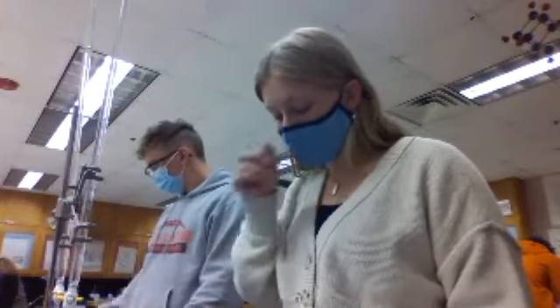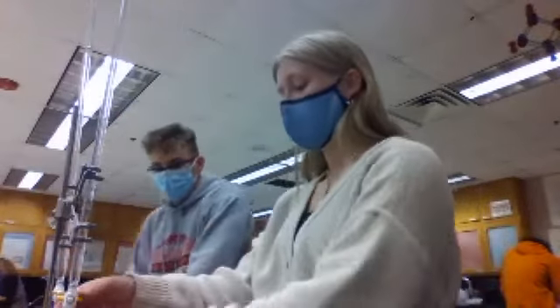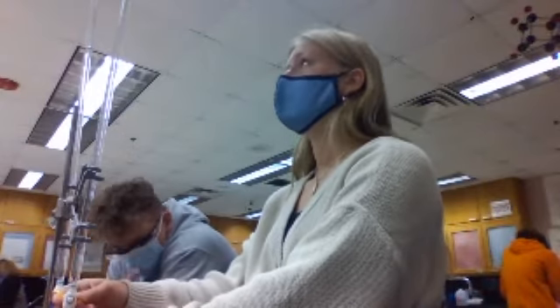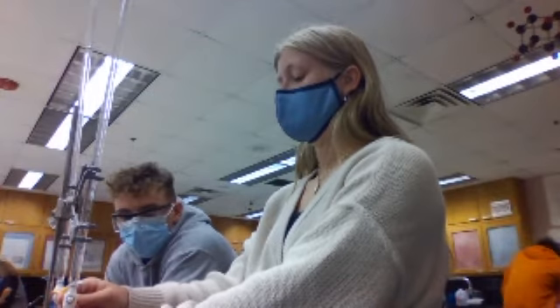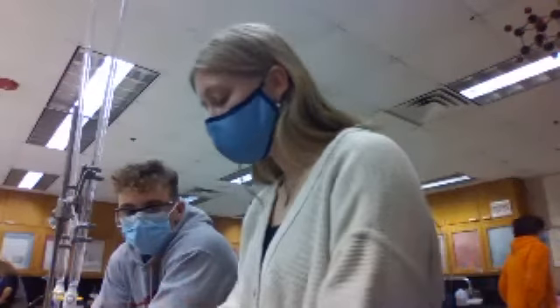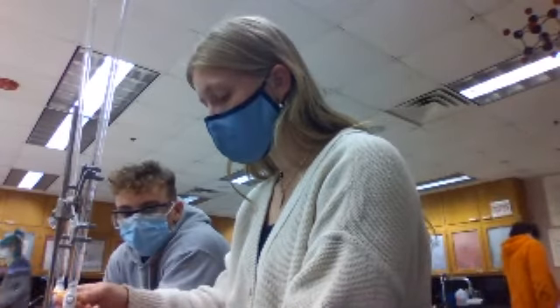Okay, so I just do it slowly until it turns blue, because you're not stopping at any increments. Right. If you want to get it dripping, then when you see it start to turn green or blue, you stop real quick. Or you can go all the way out. You can, because you know where it should go, right? So you can just let it dump until 7.